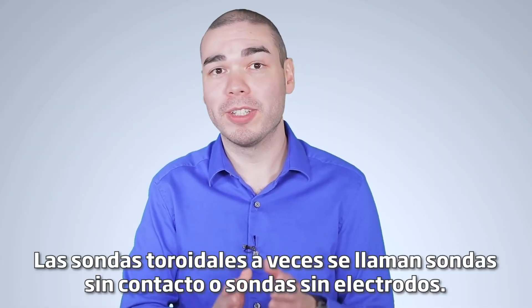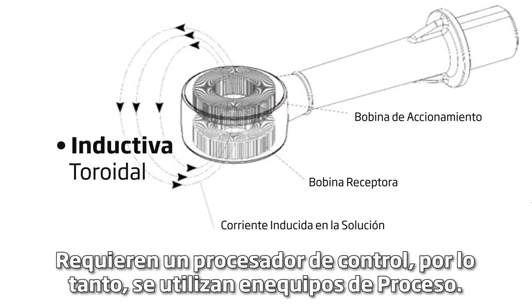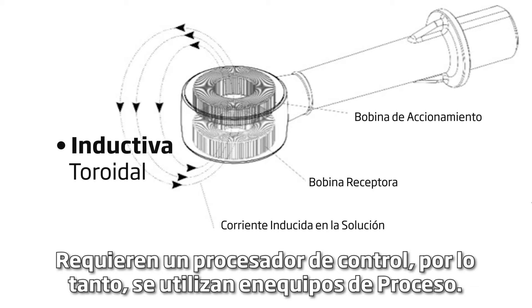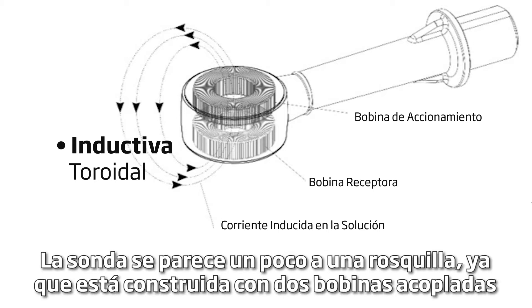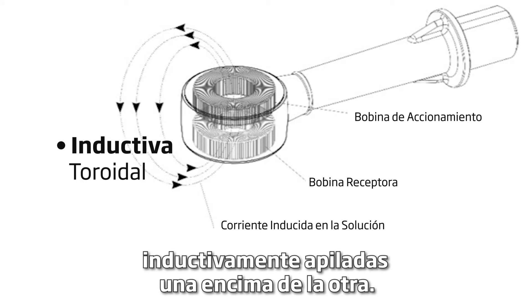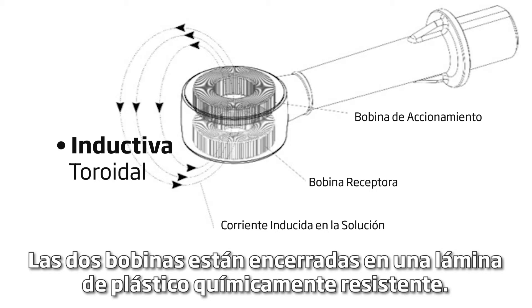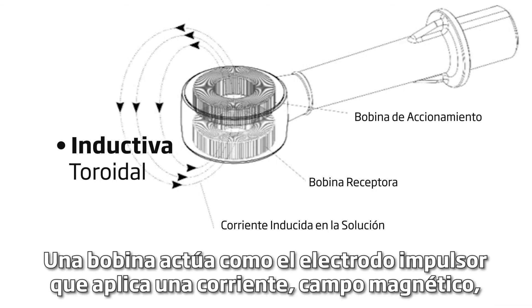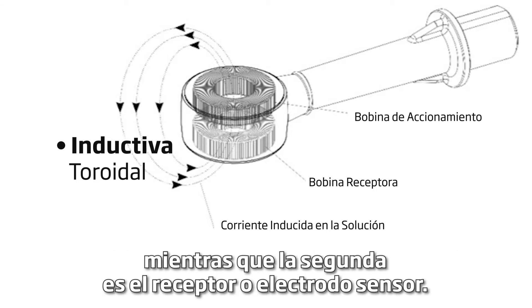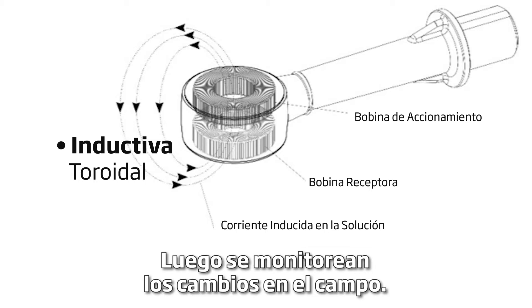Toroidal probes are sometimes called non-contact probes, or electrodeless probes. They require a control processor, so they are used in process equipment. The probe looks a bit like a donut, as it is constructed of two inductively coupled coils stacked on top of each other, encased in a chemically resistant plastic sheath. One coil acts as the driver electrode that applies a current — a magnetic field — while the second is the receiver, or sensor electrode. Then, changes in the field are monitored.